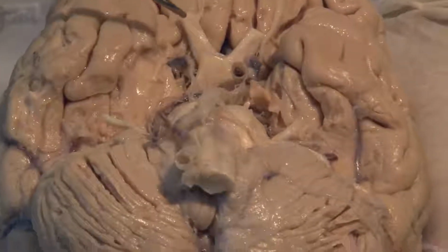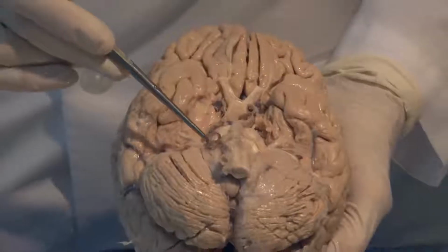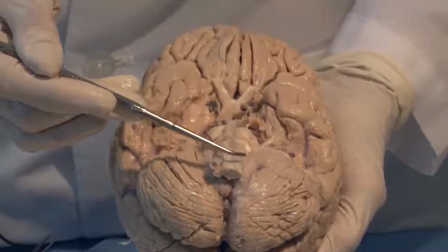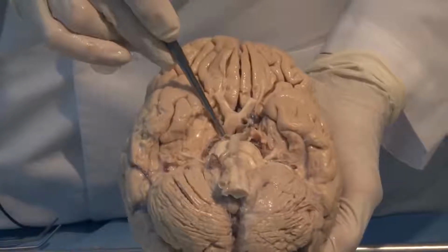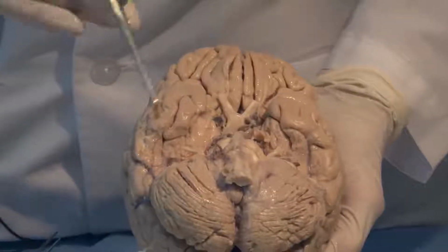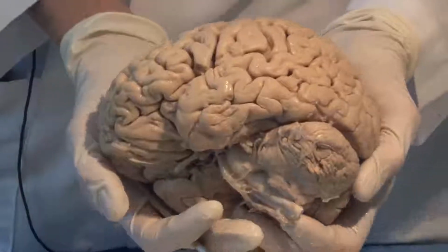We will come back and look at the nerves and the arteries and the other connections in greater detail. But I just want to introduce you to the region of the medulla, the pons, and the midbrain, and together they make up the brain stem. Let's look at the surface now of the brain and look at the different lobes.